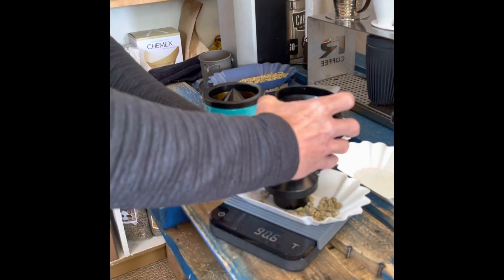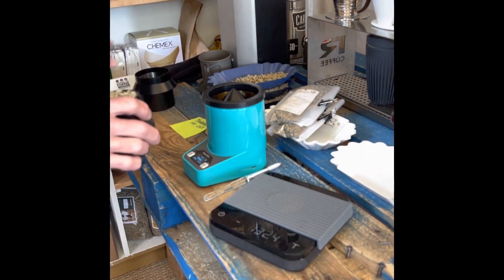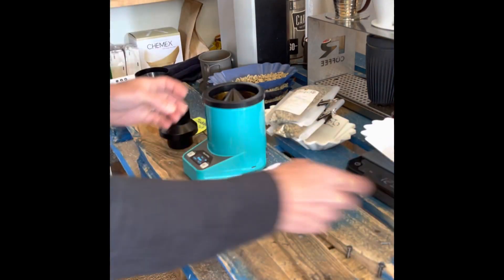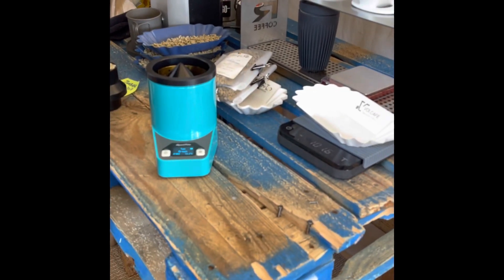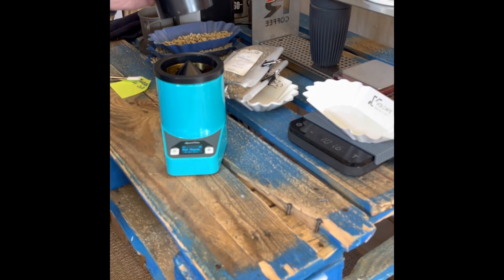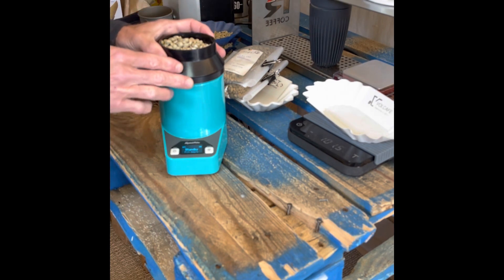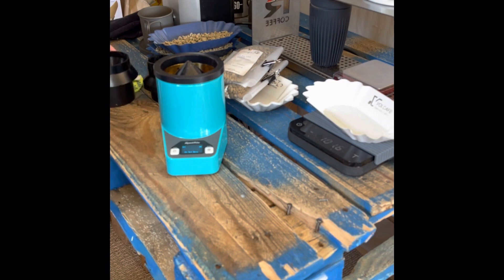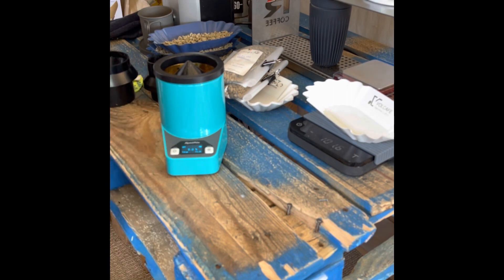Okay, it's nice and flat — you can get really precise with your flattening. I'm going to hit Enter to start. The display says 'do not move, preparing.' Then it prompts: 'put on hopper, standby, fill sample.' I lift the chamber up and place it, and now it says 'measuring, do not move.' Type is set to green — you can also set it to roast, cherry, or parchment. That reads 8.8% at 730 grams per liter.